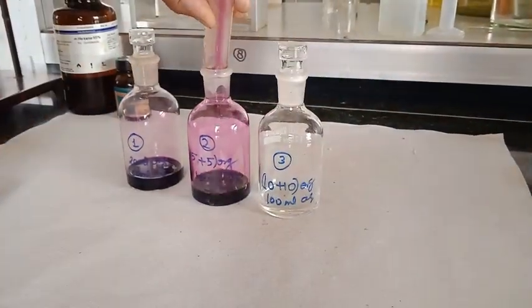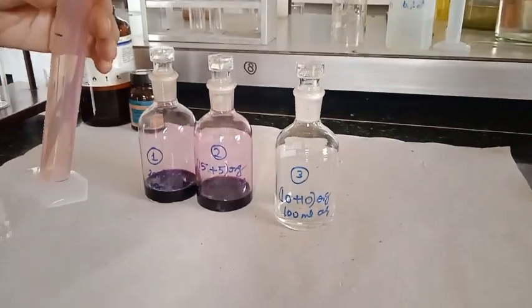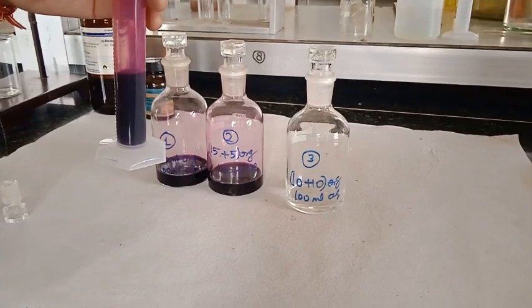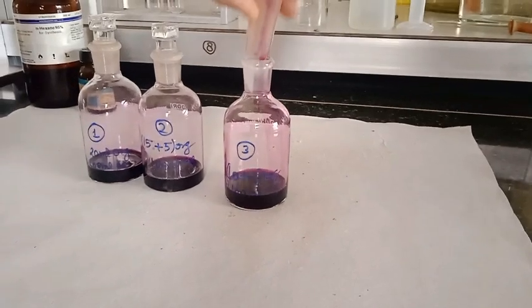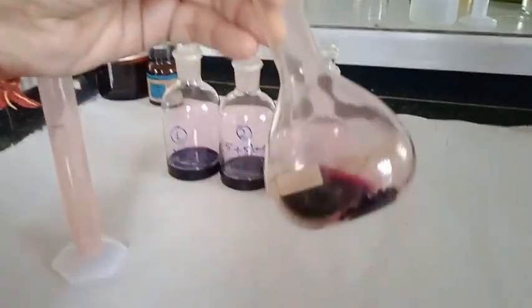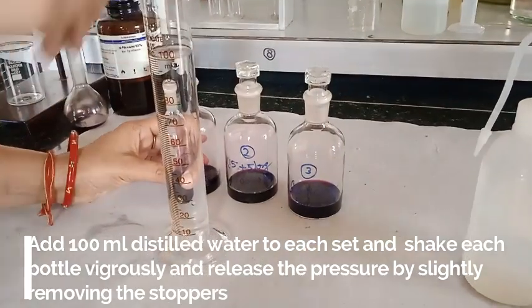Now in the third set we are going to add 10 ml of saturated iodine solution, and in this third set we already added 10 ml of n-hexane. So in this manner, in 3 reagent bottles we are having 20 ml of organic layer. Now to this we are going to add 100 ml of distilled water in each reagent bottle.